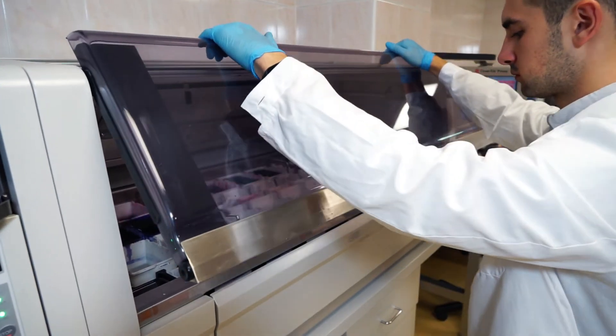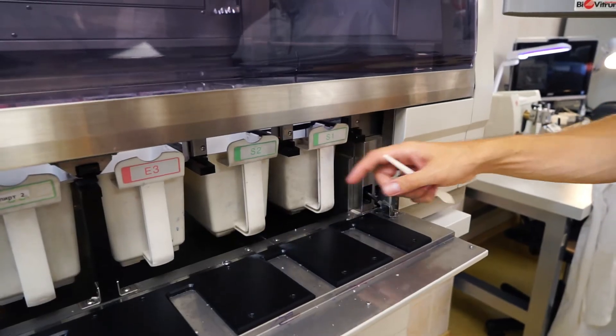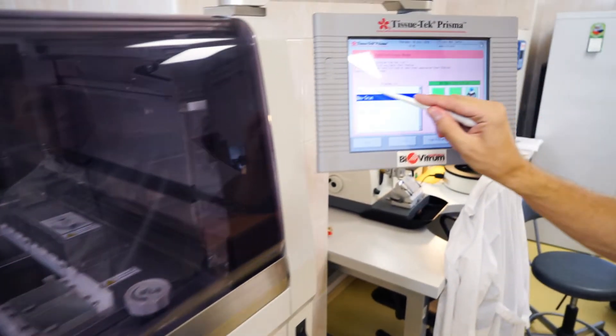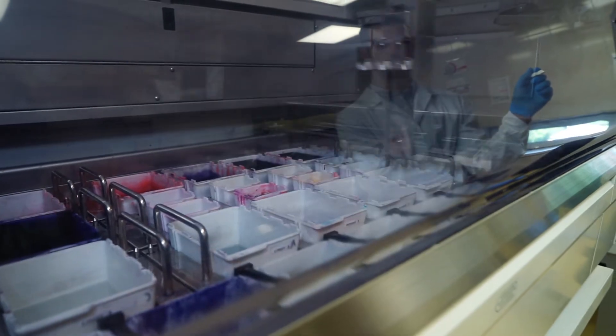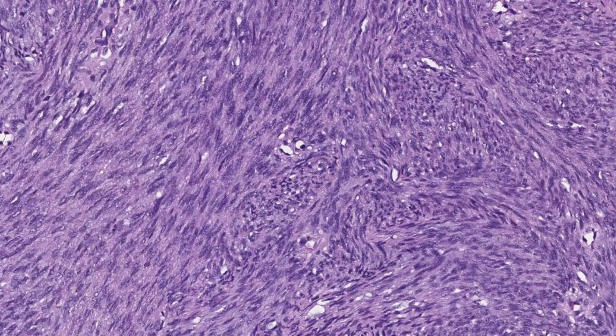One of the most popular and principal stains in histology is hematoxylin and eosin stain. It gives us an overview of the tissue and its structure. Hematoxylin binds with basophilic components of the tissue, for example DNA and RNA, so we can observe nuclei stained in blue or purple color.